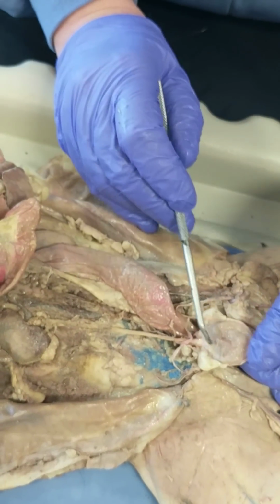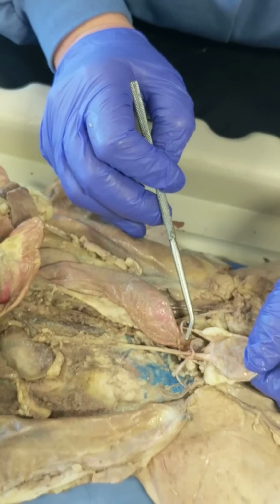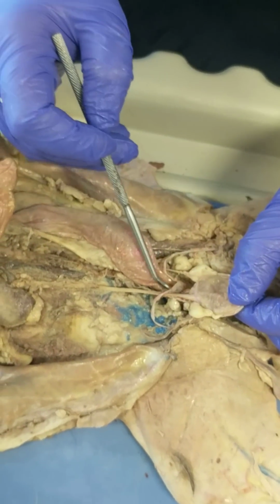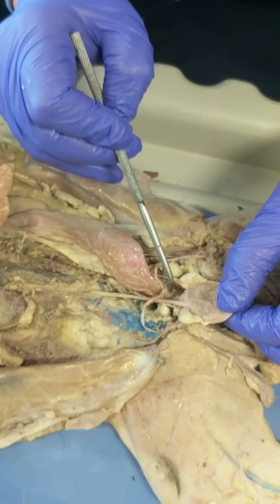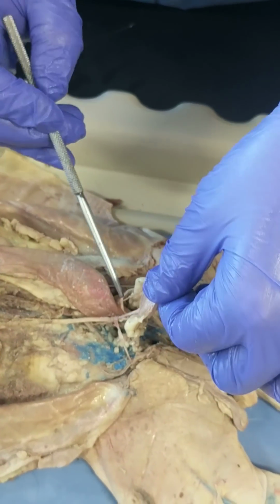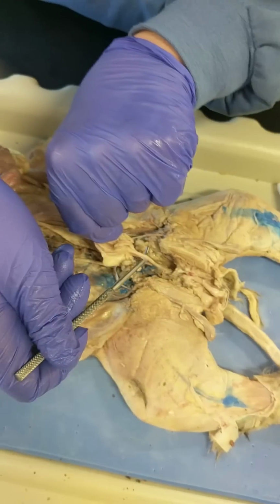And in a male cat, the urinary bladder has at its base not just 2 ureters that carry urine, but also at its base you'll find this membranous structure, which is where the 2 vas deferens, tubes that carry sperm, connect, and they're going to lead to the urethra, which also carries urine.